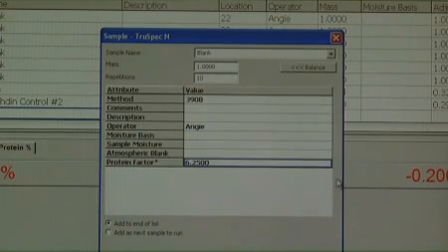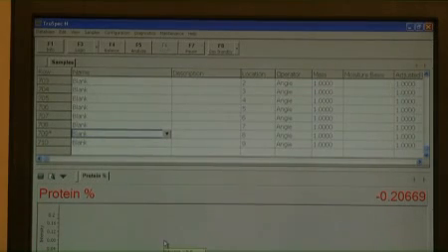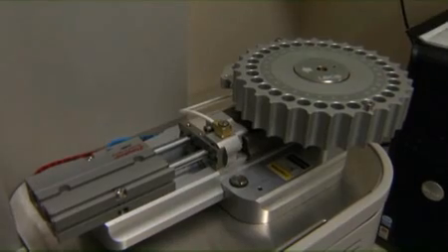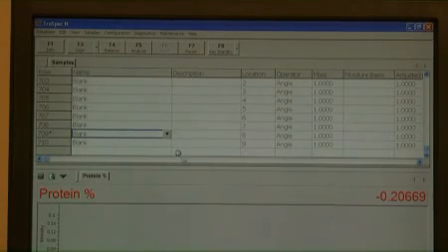In the protein factor box, enter the appropriate protein factor for the samples to be analyzed. The protein factor for the blank must be the same as for the samples. No other values are necessary for the blank login. All values can also be entered directly into the spreadsheet using the Enter key to add lines. Verify that the first position of the blank corresponds to the next position on the auto sampler carousel, as indicated by the numbers in the sample spreadsheet. Select the Analyze button at the top center portion of the screen to begin the blank analysis.